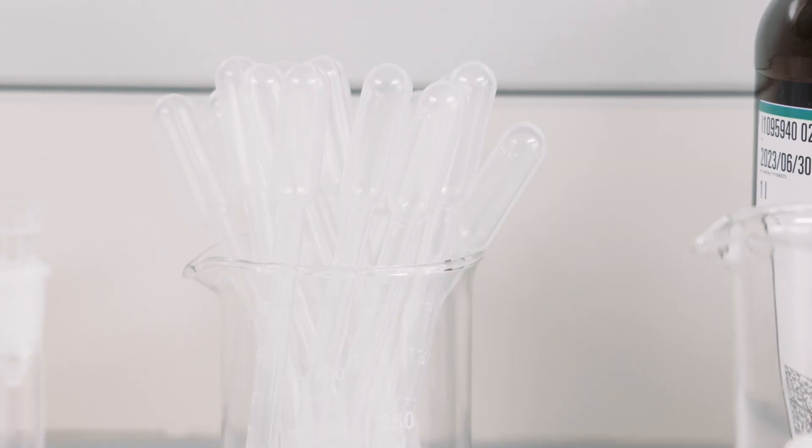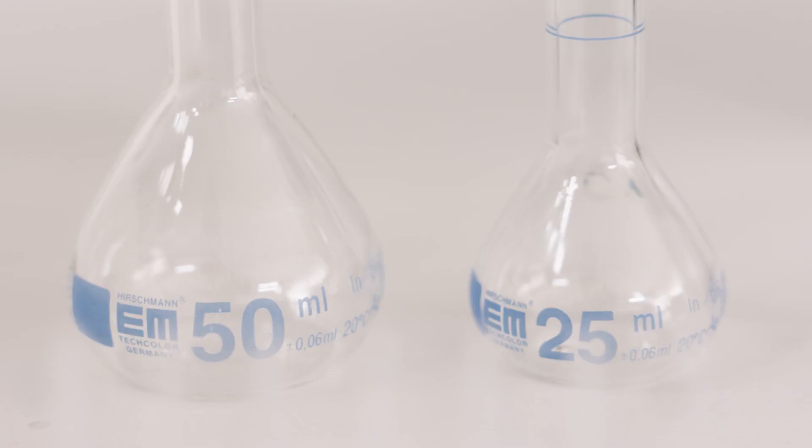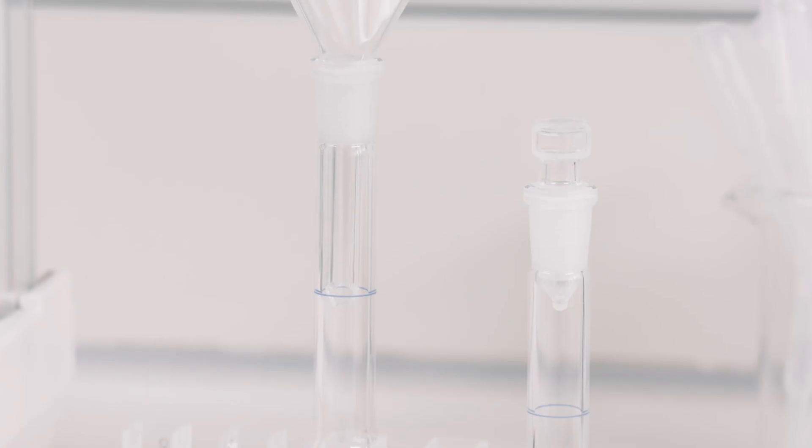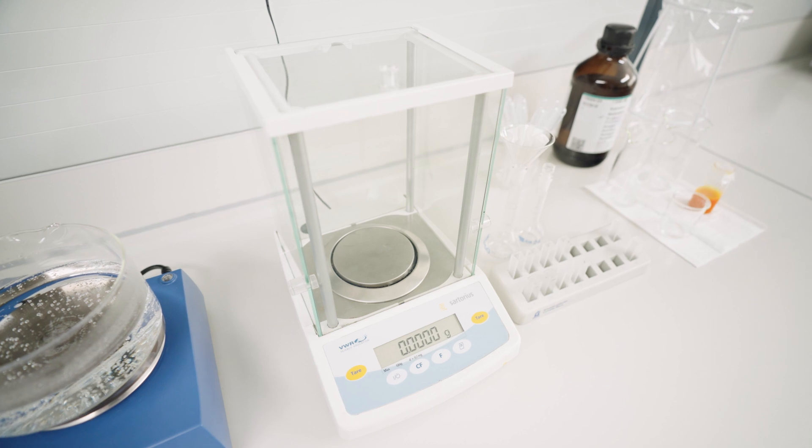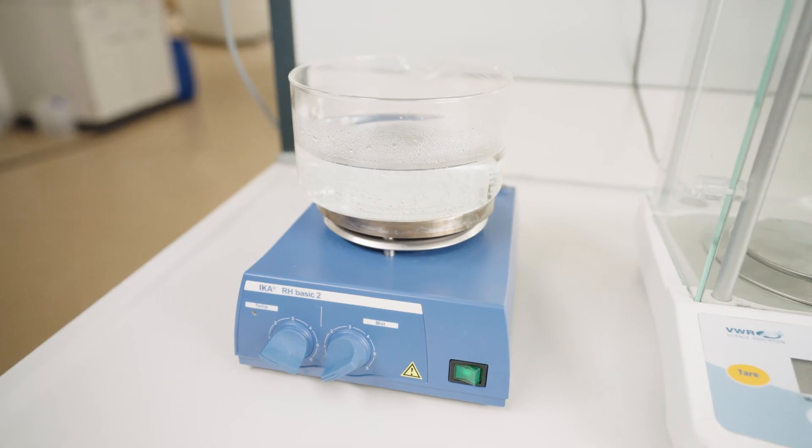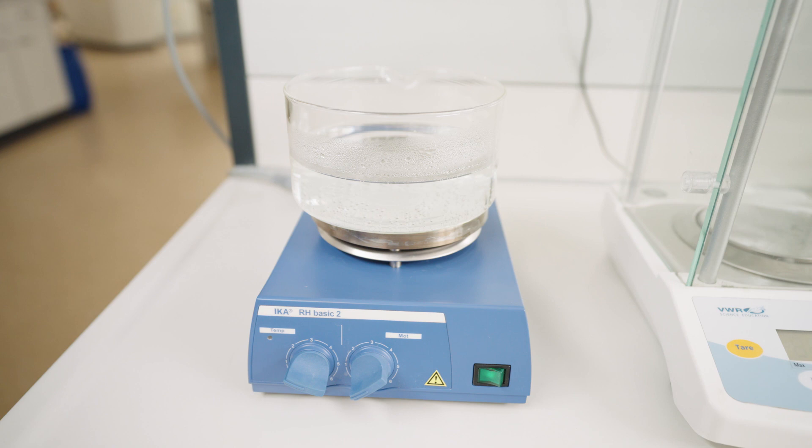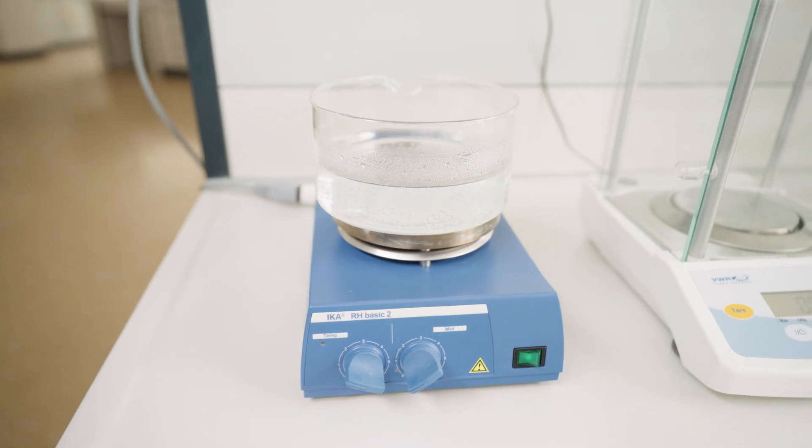We will also need some Pasteur pipettes, a 25 ml volumetric flask with a suitable cap, a high-precision balance, and last but not least, a heating panel with a beaker full of distilled water to liquify the crude palm oil.